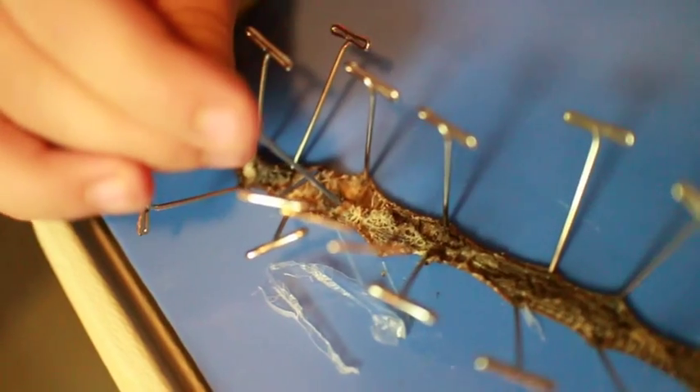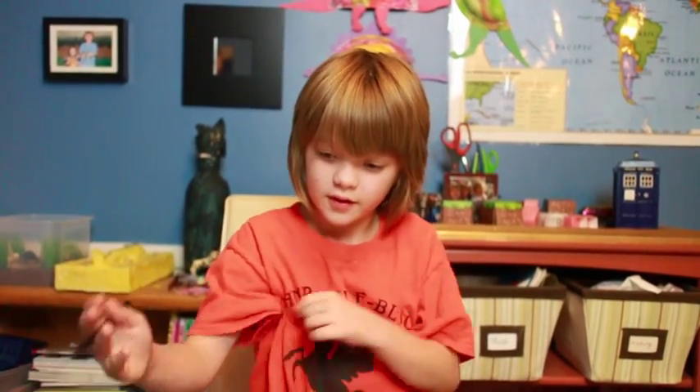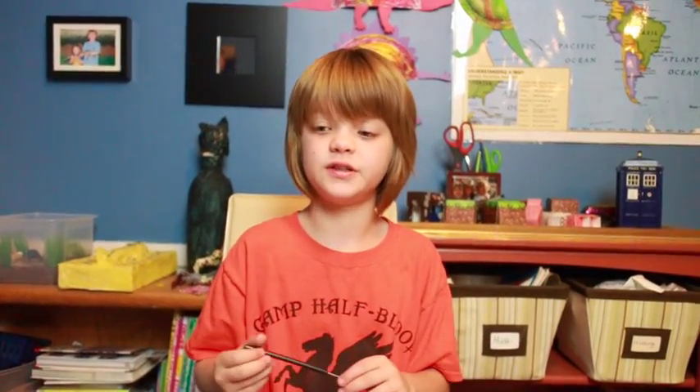And here is one of the only things I didn't destroy with my scalpel. The blackish one right there is the crop. The crop holds dirt — it is designed to expand, and that's where all the dirt is held. And then the gizzard breaks down the dirt. And then there's the really, really long digestive system. Actually, this whole worm is mostly digestive system, because worms don't really do much other than digest stuff.